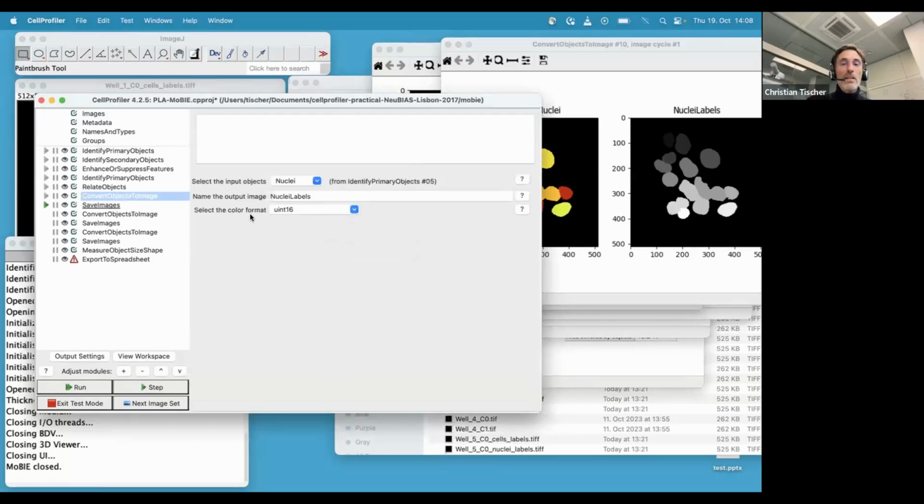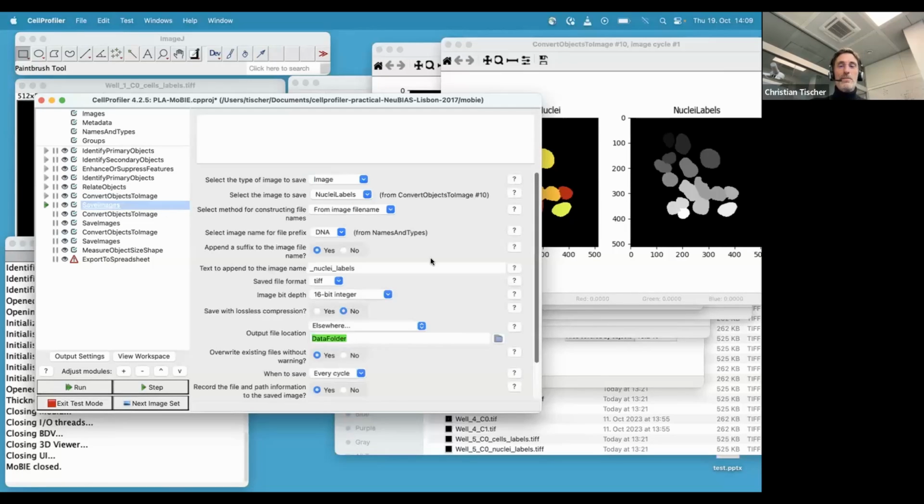And in CellProfiler, how you do this is this convert objects to image module, and it's important that you say you want to create a uint16 image, because then you can have up to 65,000 different objects. So you need to do that, and then you have to save it, okay? And again, as a 16-bit integer TIFF.